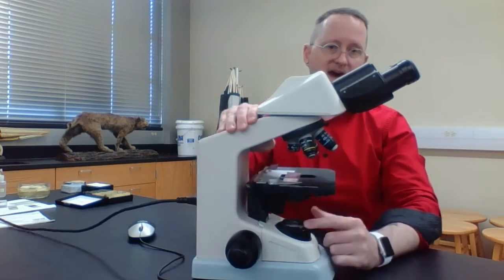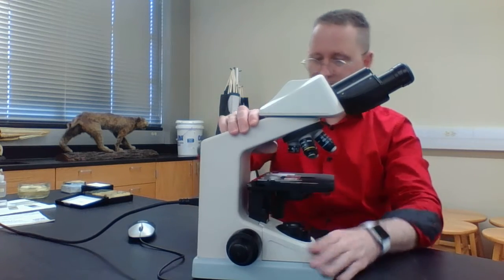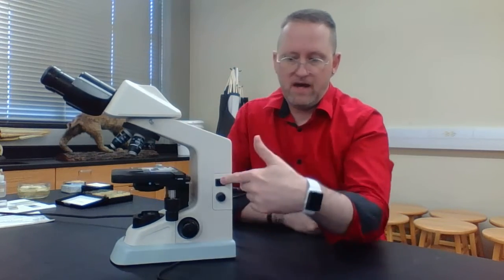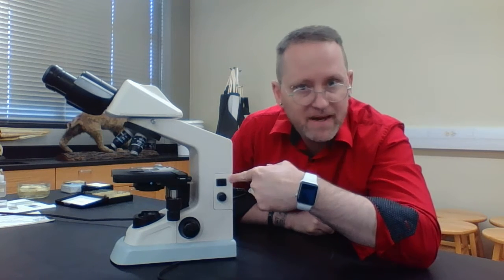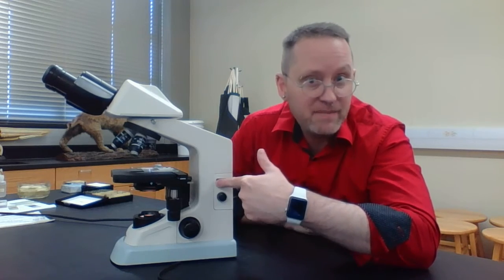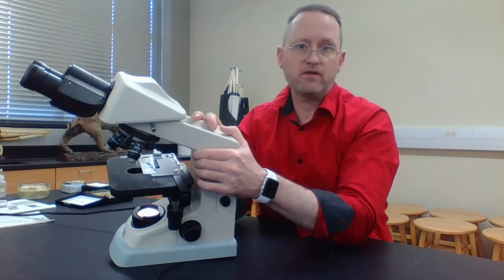Then we have, again, the light source. So there's actually a light bulb attached here. I do want to make a point. When I turn my microscope around, I have my power switch here. Notice it's towards this big zero right here. It's basically off. When I switch it on, there's a little line right here. That means the power's on. You could actually see that my light bulb is on.